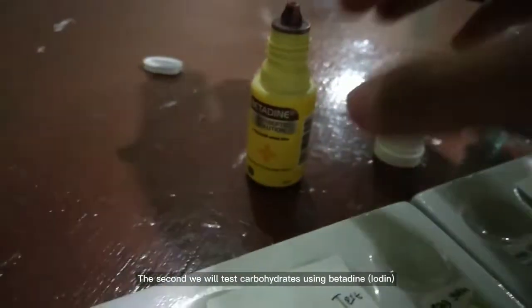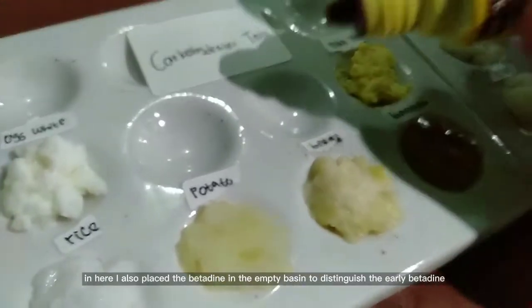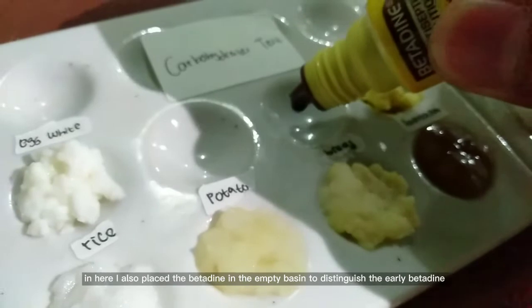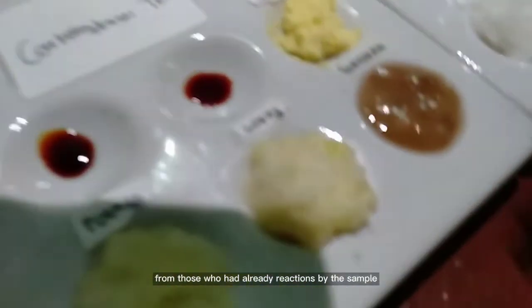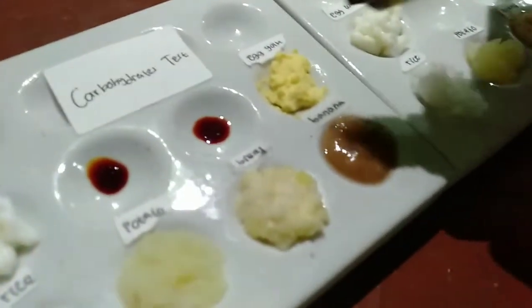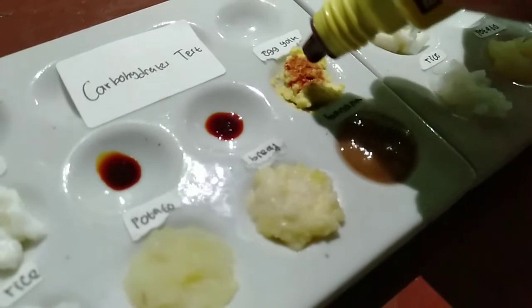The second, we will test carbohydrates using betadine. In here, I also placed the betadine in the empty basin to distinguish the early betadine from that which had reacted with the sample. Now, we're going to drip each 2 drops to the sample.